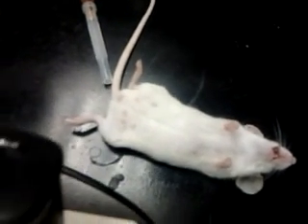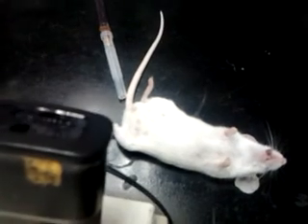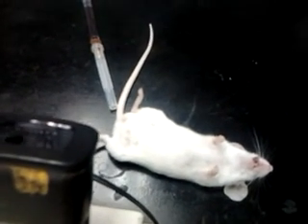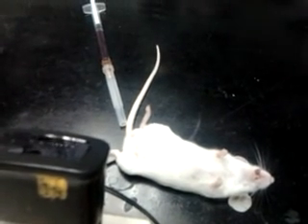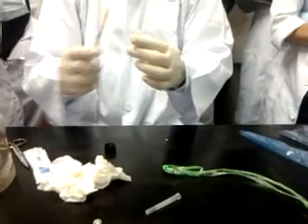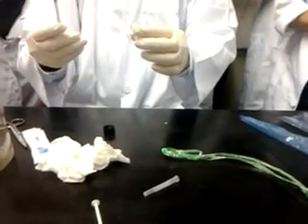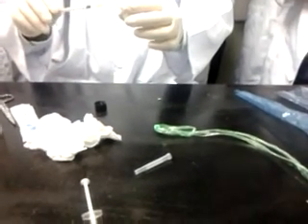Why do we need to learn the IV technique? Because when you learn IV, you need to inoculate certain viruses into the animal. Also, microbiologists use IV. Even pharmacologists who want to do toxicology of drugs, or see the breakdown of morphine, have to give IV to the animals and then collect blood at different hours to see the breakdown. So you have to use IV to accurately give the dose. This IV technique is very important for most medical and pharmacy procedures, and overseas you also have to learn how to do IV.